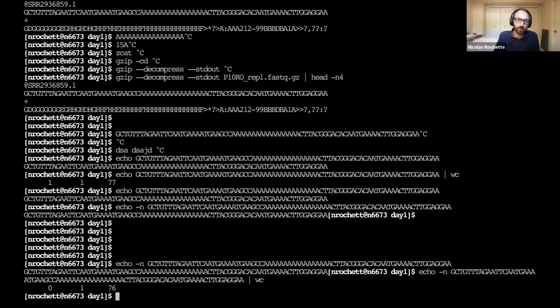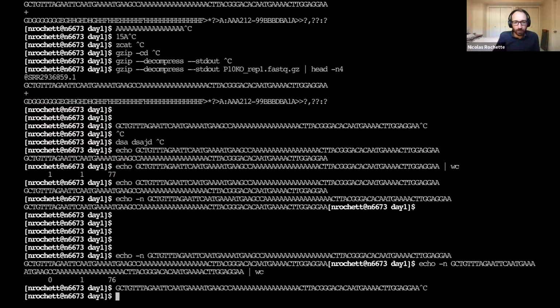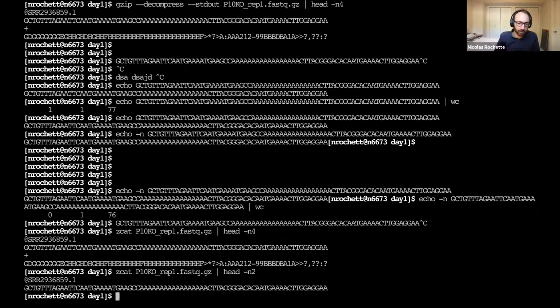One way, so, what if we don't want to use echo and copy paste? What if we don't want to copy paste and just ask for the length of the second line in the file? Again, we can go back to our zcatting of the file and use autocomplete. And then we can show the first 4 lines. And if we can open the first 4, we can actually open the first 2 as well, right? And then the sequence is the last line.